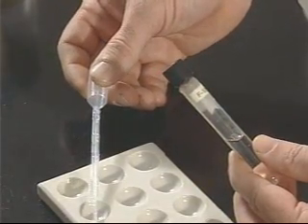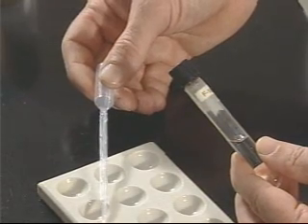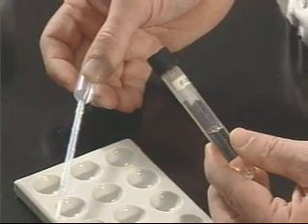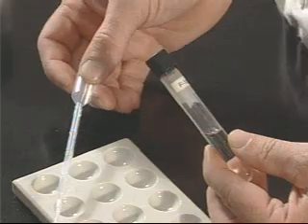You might be lucky and identify it in the first test, or you might need to perform all of the tests. By following good observational skills and using good reasoning skills, which are the real reasons for you doing this lab, you should be able to easily identify your unknown sample. When you're finished with your unknowns, be sure to clean up after yourself. You need to record your results from the unknown onto your result sheet, and you must take the waste material in the waste container up to the hood and pour the contents into the special receptacle there. I hope that you had good success with this experiment and that you identified your unknowns correctly.